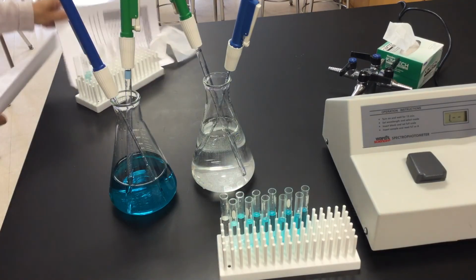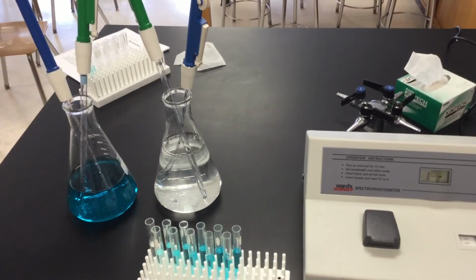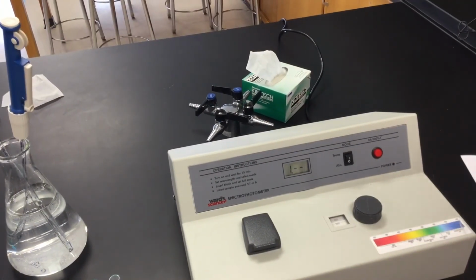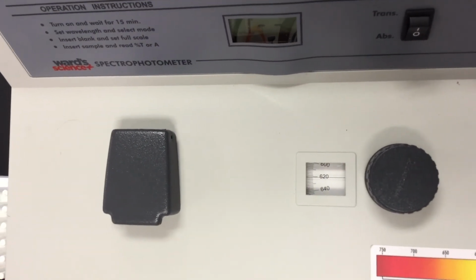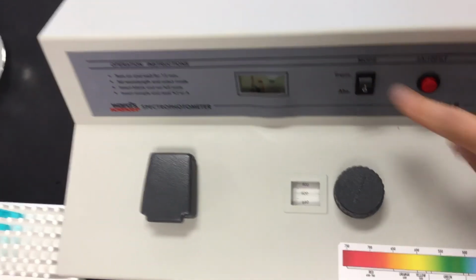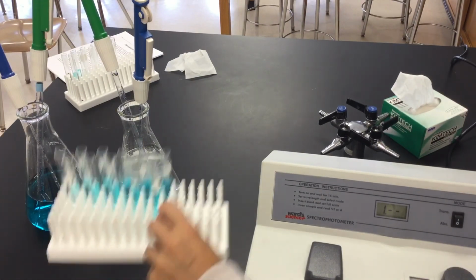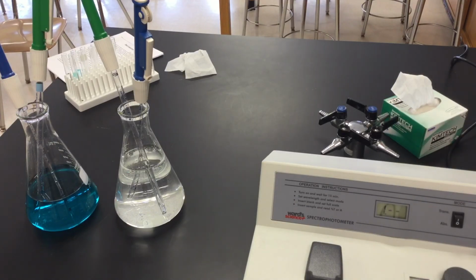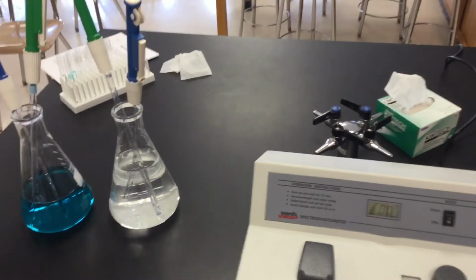Part 3 is pretty quick, pretty easy. I'm just going to be swapping out tubes. So what am I doing? I'm going back to my spectrophotometer. Remember, for part 2, I said we are going to set that spectrophotometer to my maximum absorption from part 2, and that was 620 for that particular copper sulfate. So I'm setting this to 620. My toggle switch is set to absorption, and I'm going to start out with water, because that's what tube number 1 actually is. So I pop it in, and at absorption, I want to re-zero this now.